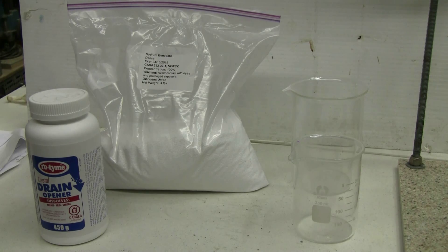In this video I'm going to attempt to prepare benzene. The chemicals that were available to me in order to attempt to prepare benzene are sodium benzoate and sodium hydroxide.